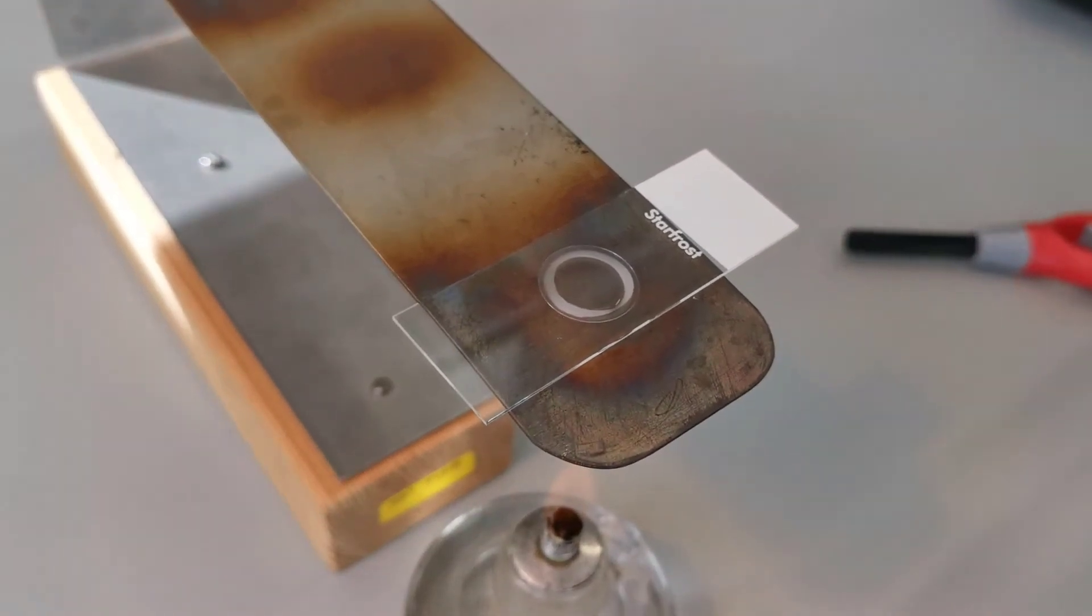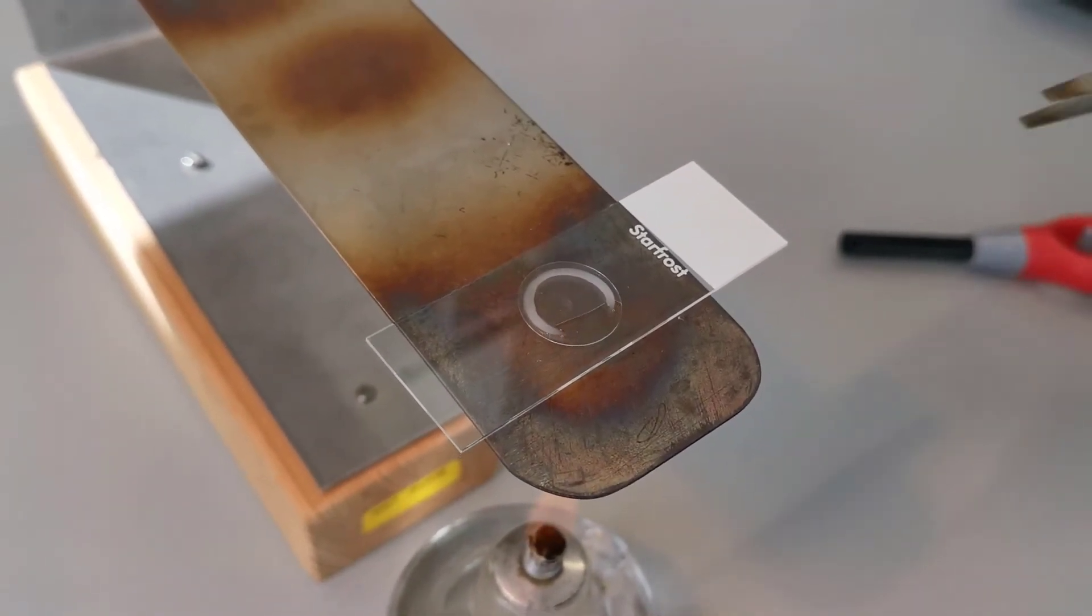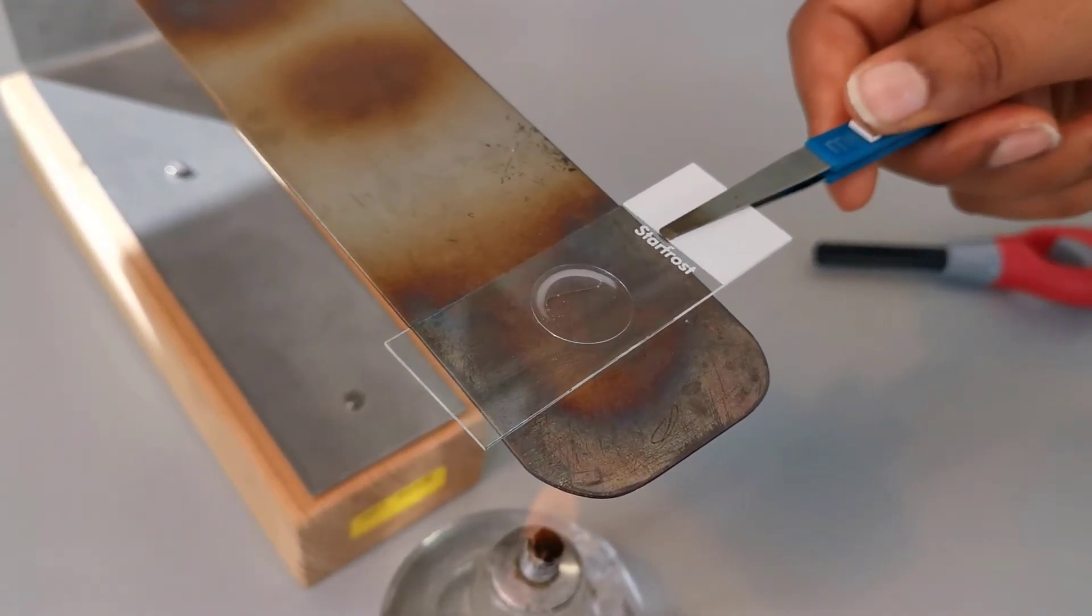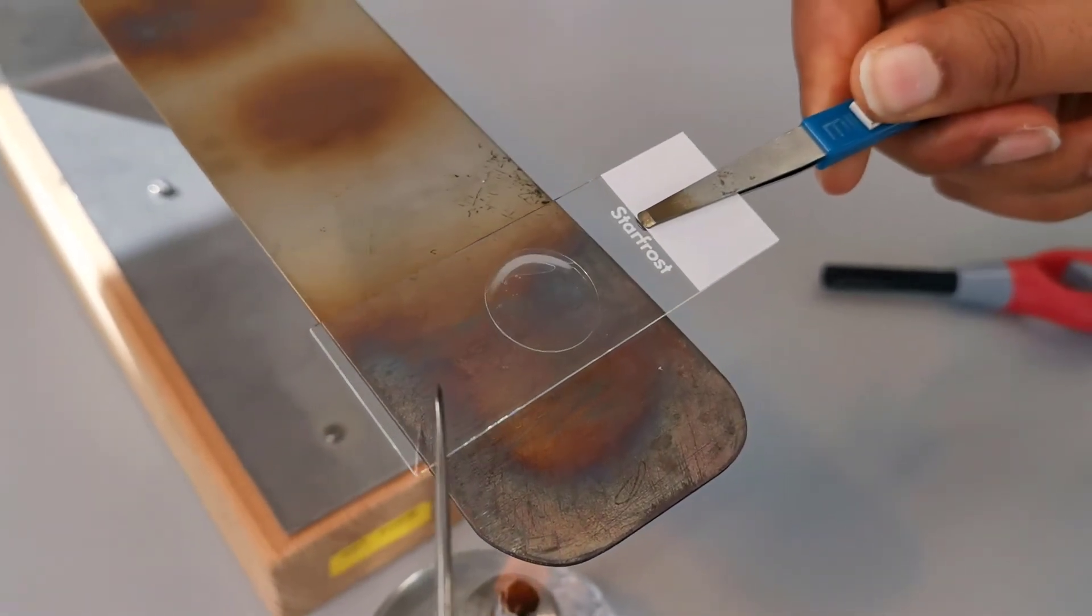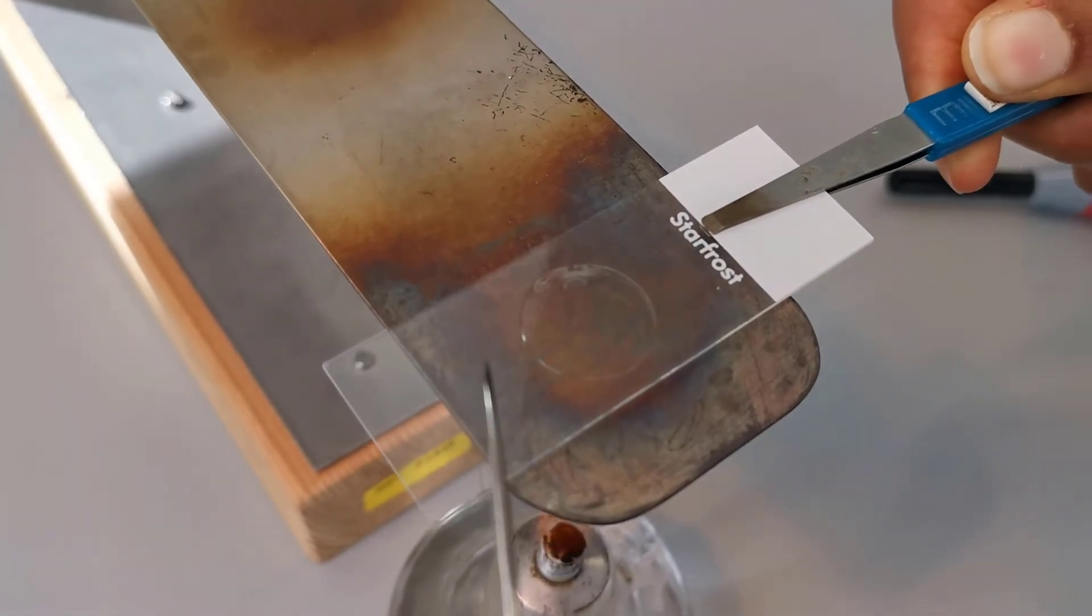And if you see any air bubble forming in the wax, gently tap the slide using a needle to stimulate movement of the bubble out of the cover slip as shown here.